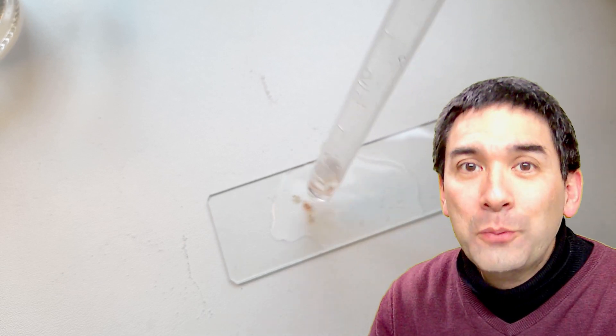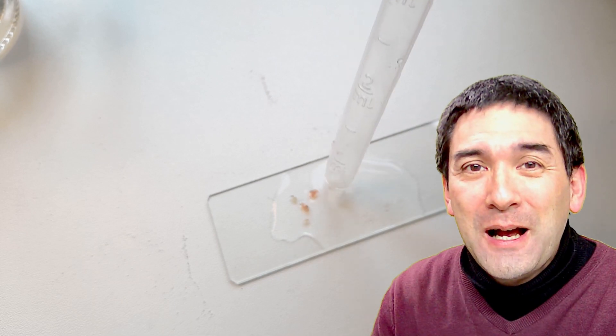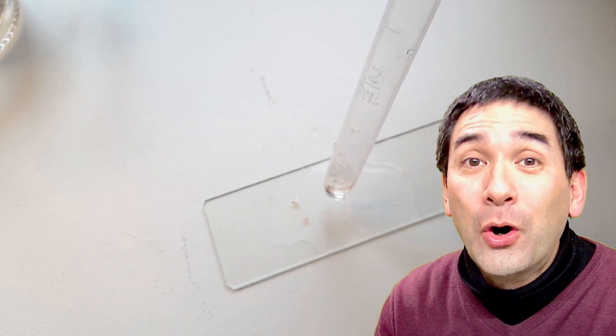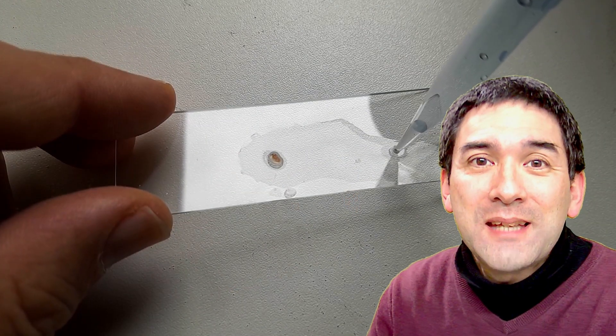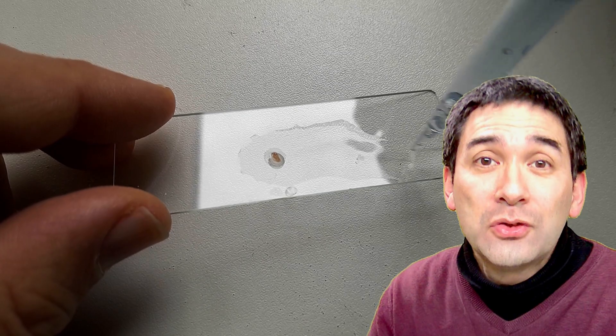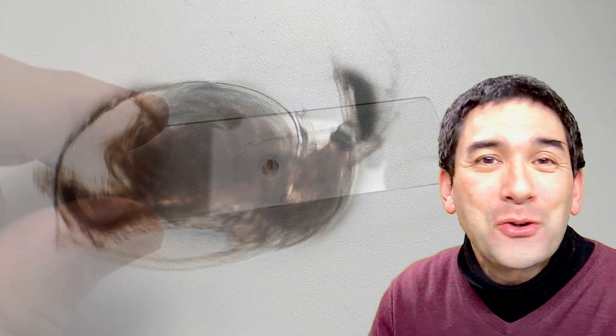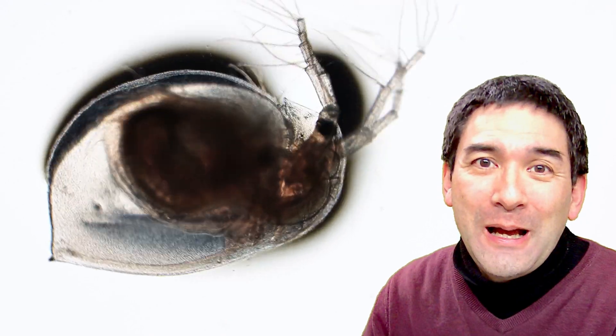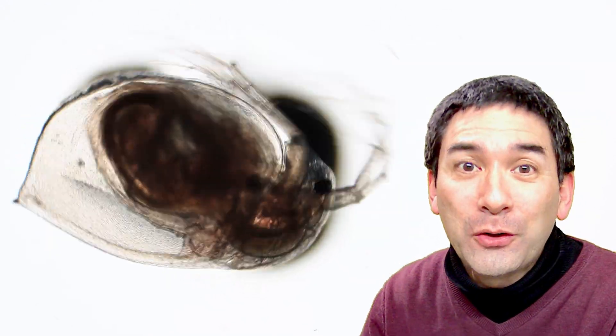And yeah, there are actually far too many of them now on the microscope slide, for this reason I had to remove a few. I also did not want to harm too many of them, so I just basically removed all of them except one, and I also used my pipette to remove any excess water because of course I'll be adding a little bit of alcohol.